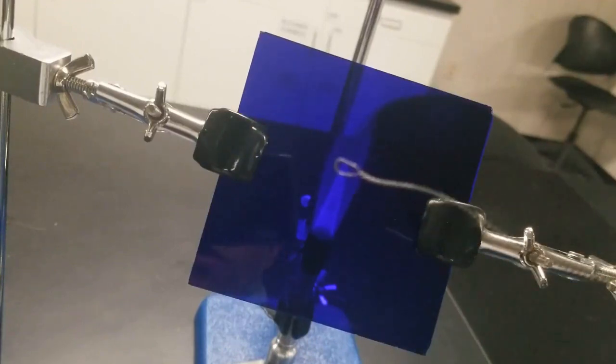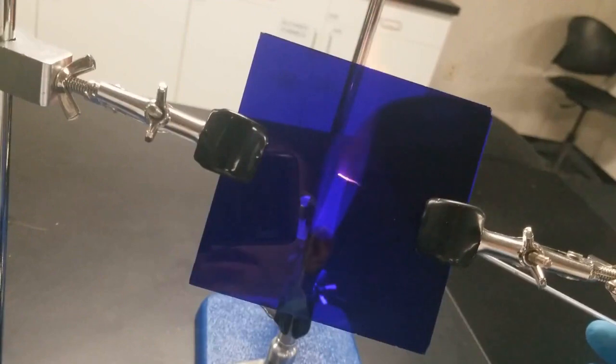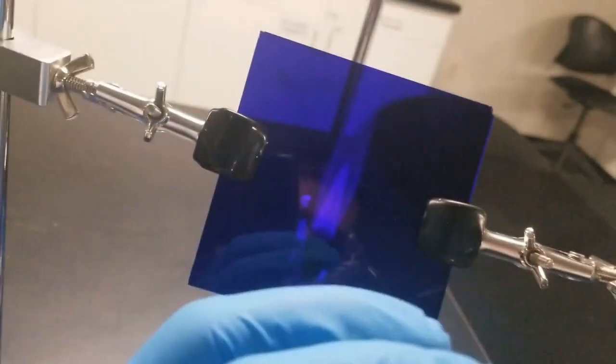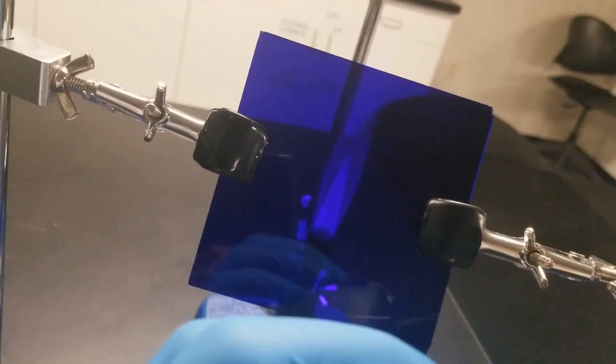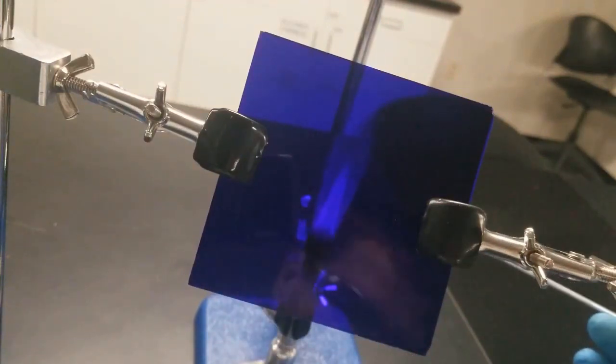All right, so I've washed this off a couple times. You can see when I put it back in the flame, there's still a tiny amount of lavender there, but it's not too much. So let's go ahead and see what happens when we dip our unknown into here. So I'll take some of my unknown and then dip it in this flame for this flame test.